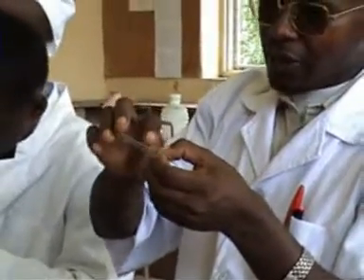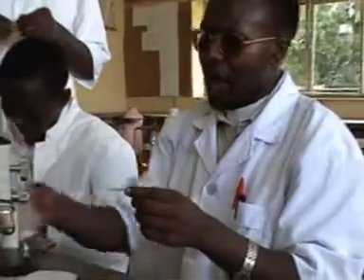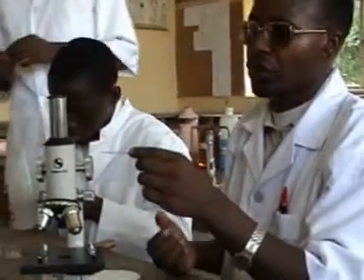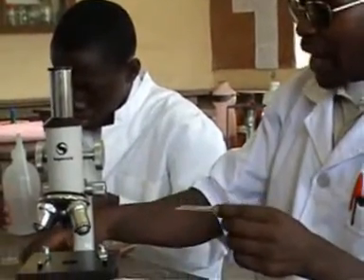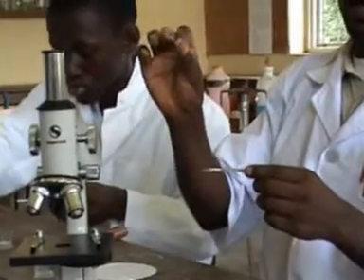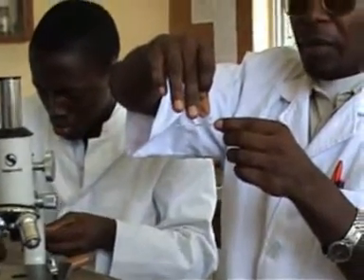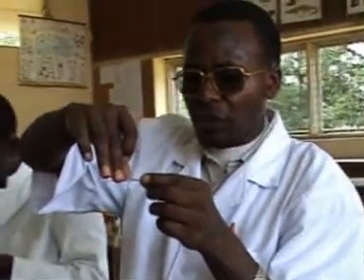So when I put it on the empty glass slide now, I'll be required to add water. That is, I irrigate it in water. So I add a drop of water. So usually, a candidate can be given various solutions on which to irrigate the slide, the specimen. So when I add a drop of water, I then take my cover slip and I cover my preparation. So I cover it by starting from one side, getting to the end.